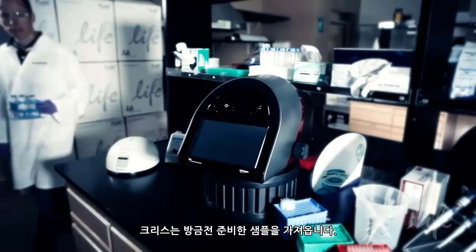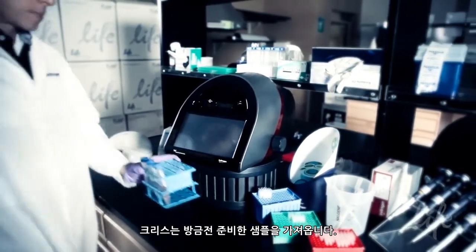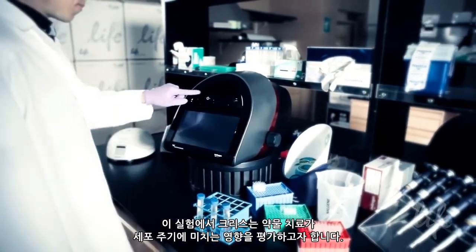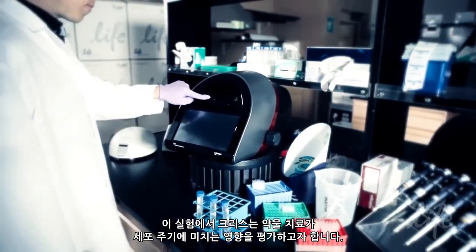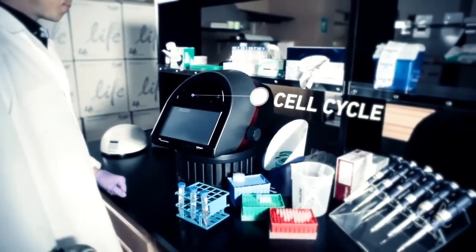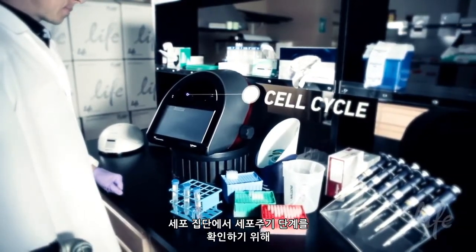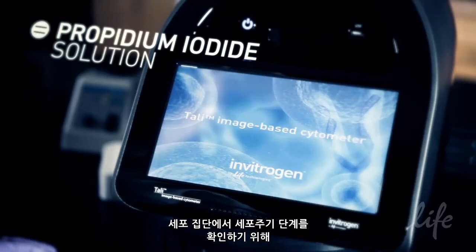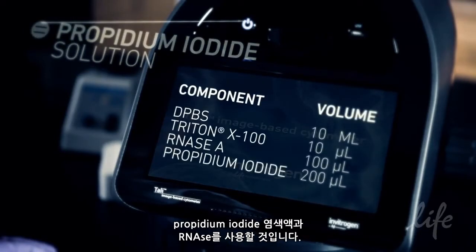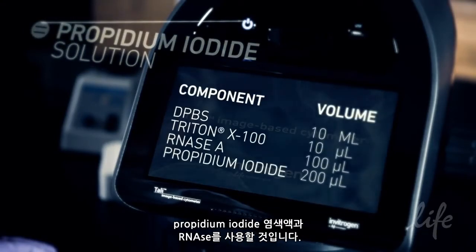Chris has a freshly prepared aliquot of his sample. In this experiment, he wants to evaluate the effect of a drug treatment on cell cycle. He will use a propidium iodide staining solution with RNase to identify stages of the cell cycle in a population.